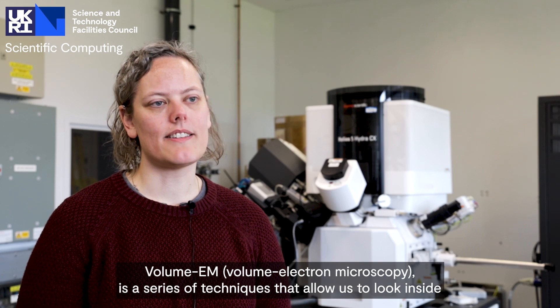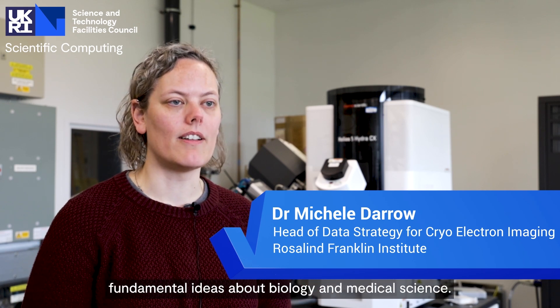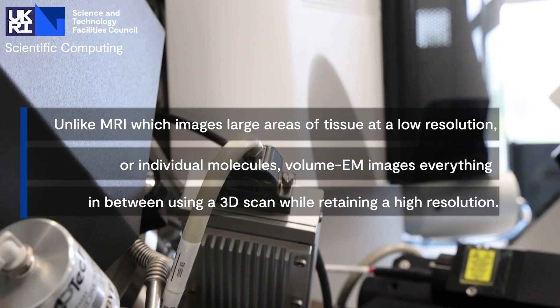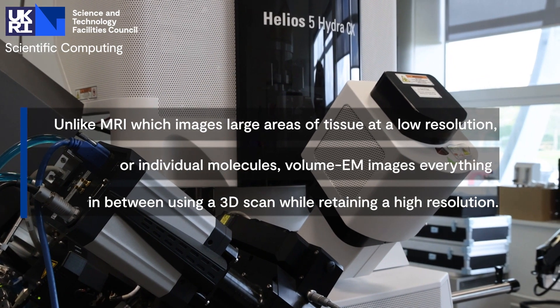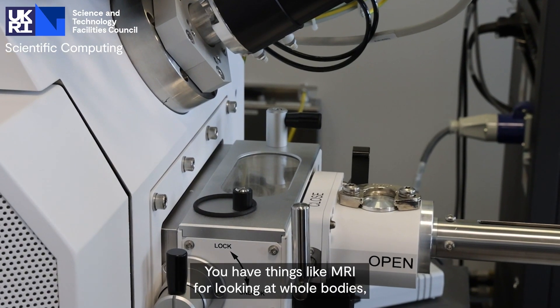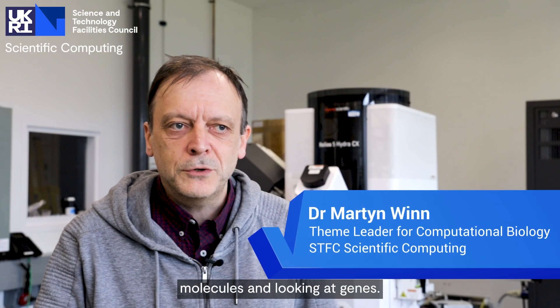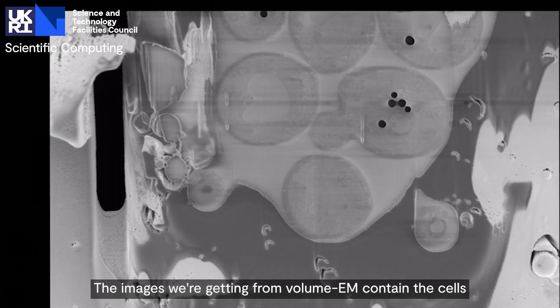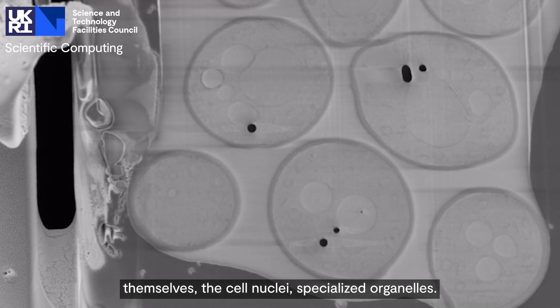Volume EM is a series of techniques that allow us to look inside of the cell or inside of tissues and try to understand fundamental ideas about biology and medical science. You have things like MRI for looking at whole bodies, and then we have a set of techniques that look at molecules, looking at genes, but this sits in the gap in between. The images we're getting from Volume EM contain the cells themselves, the cell nuclei, and specialised organelles.